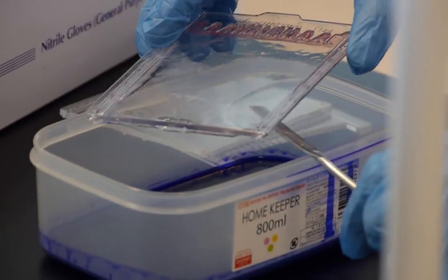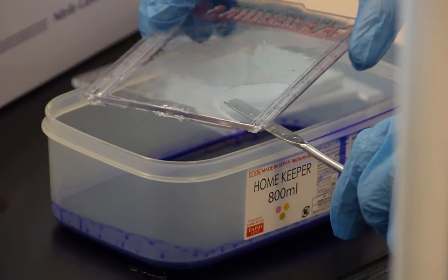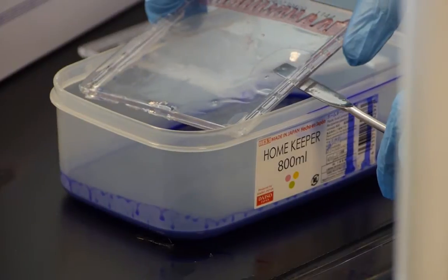The gel was placed over a tank and eased off the plate with a spatula into the blue Coomassie dye.